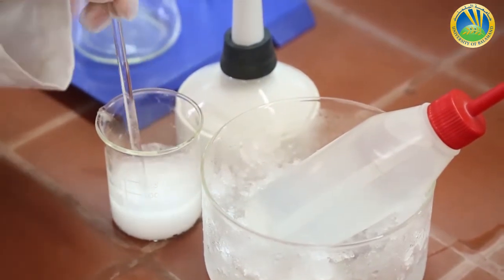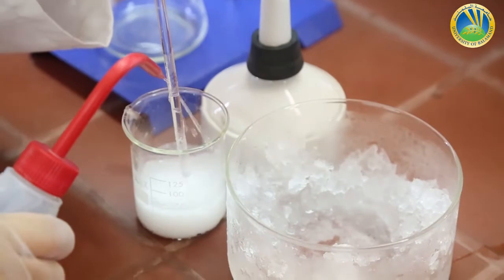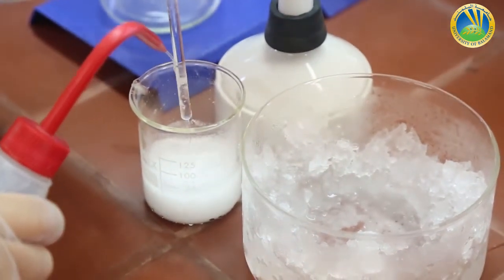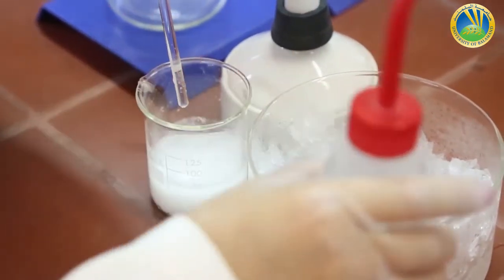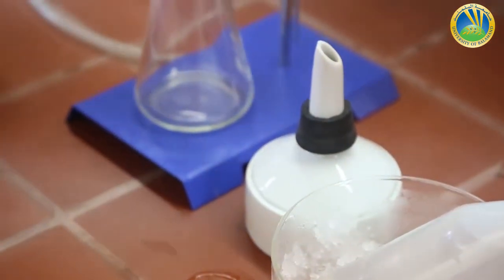Now my solution is cold enough. I will filter it using the Buchner filter but I will prepare it and let you remember how to prepare the Buchner filter.